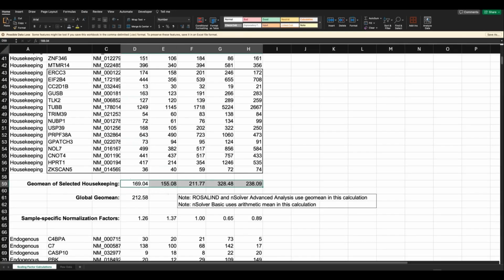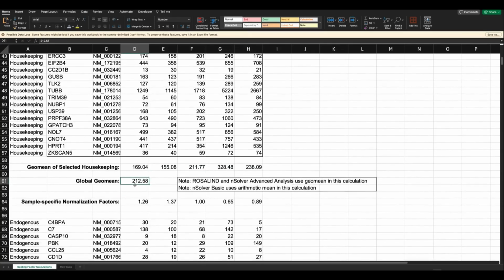Then we take the global average. So we're going to take the global geometric mean of all these values. That's represented here. Finally, to make our factors, we just do a ratio. It's simply this value versus this value. So this 1.26 is calculated by this global mean versus sample number 1. This 1.37 is the ratio between this mean and sample number 2. And this is the ratio between the global mean and sample number 3. So the way to interpret this is that the value is the distance between the average expression of housekeepers in a given sample versus the average of the whole experiment.